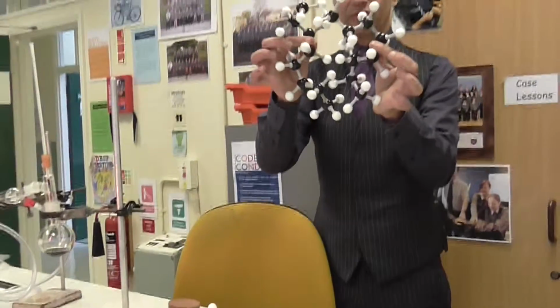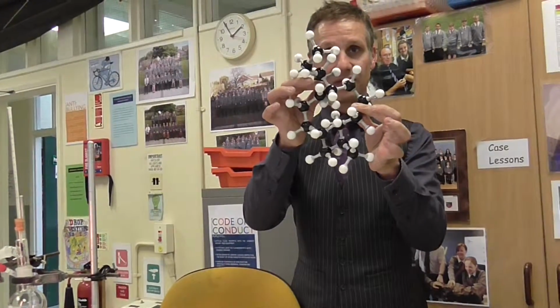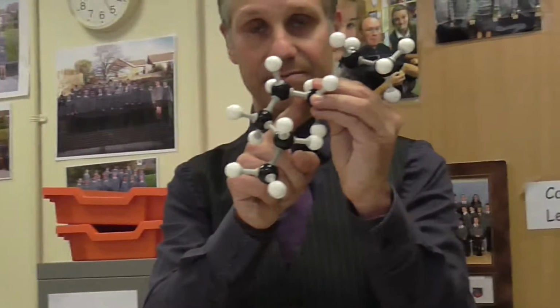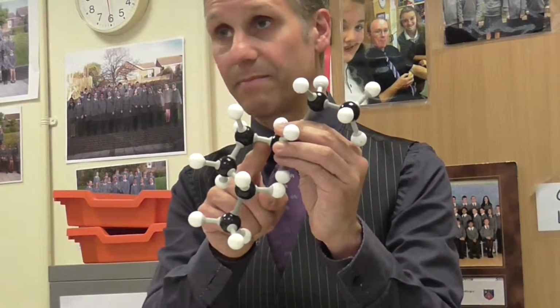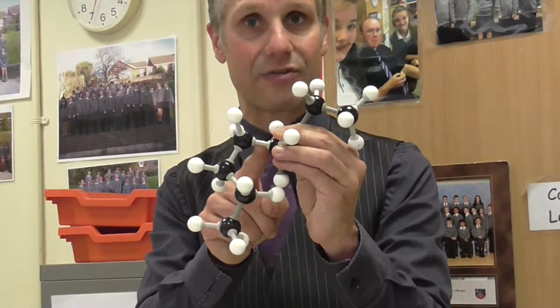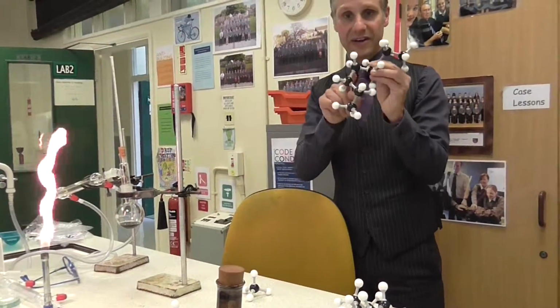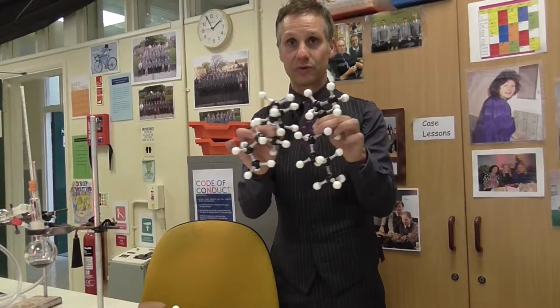What is holding the hydrocarbons together is just weak intermolecular forces. Don't get confused with the idea of these things here. These are covalent bonds. These are very strong. In order to break one of these, you need a much higher temperature, and that will be covered in a later topic called catalytic cracking. So these do not break. When I'm heating this using a Bunsen burner, it simply won't have enough energy to break covalent bonds, but it will be able to overcome the intermolecular forces.